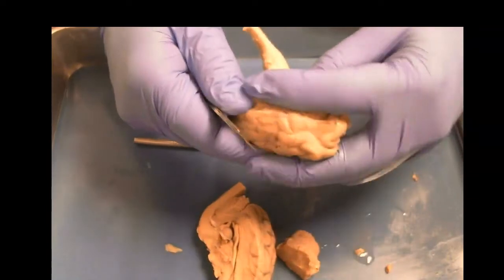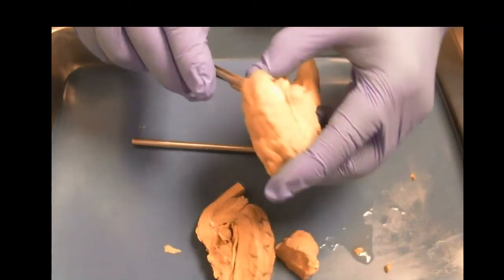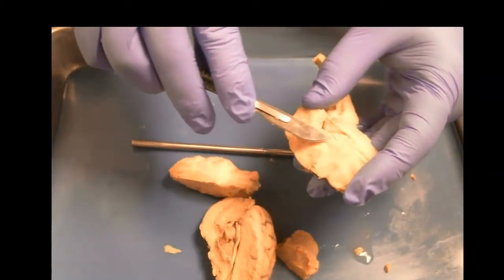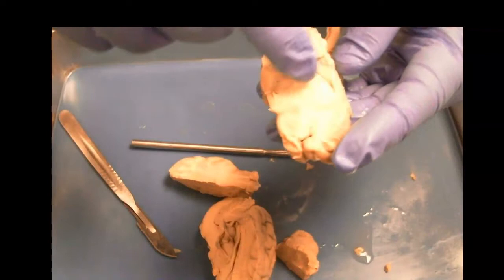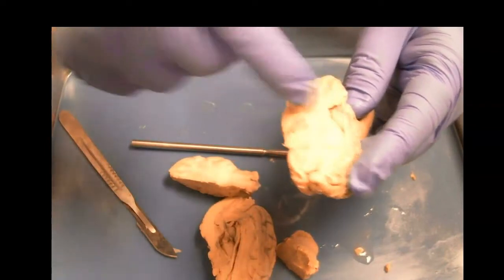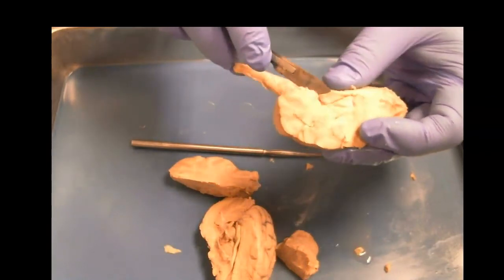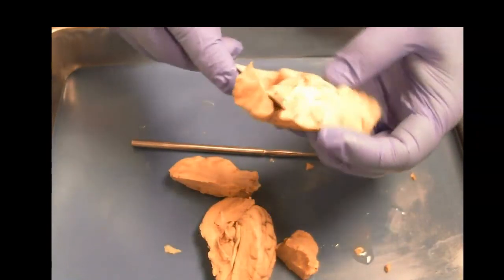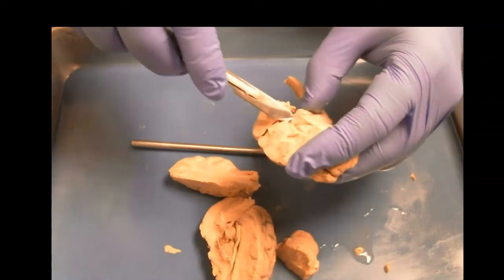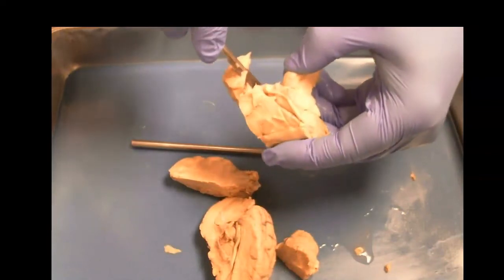So if we can get in there by removing, I'm going to start by removing this part at the top of the cortex here, carefully. And we see some of this tissue here wrapping around. So the hippocampus is going to come basically around like this into the temporal lobe. And we can see some of this tissue that looks like it might be part of that connection. So if we strip off a little more of this, that's what we're looking for, wrapping around. We see this right here wrapping around into the temporal lobe. Recall, both the hippocampus and the amygdala are going to be in there, but they're really hard to find. It looks like I'm slicing through it too.